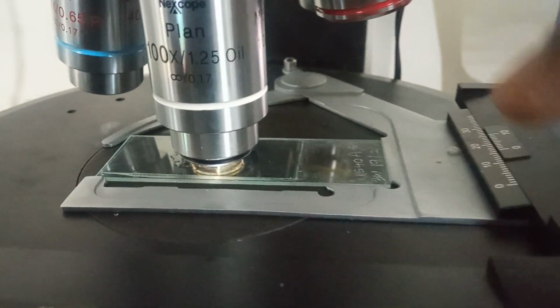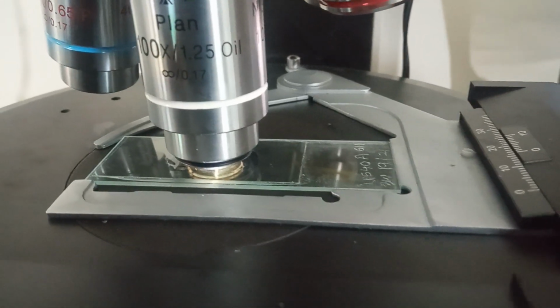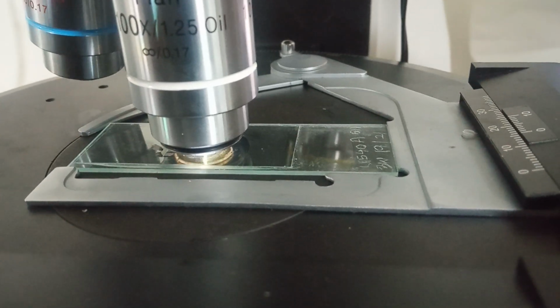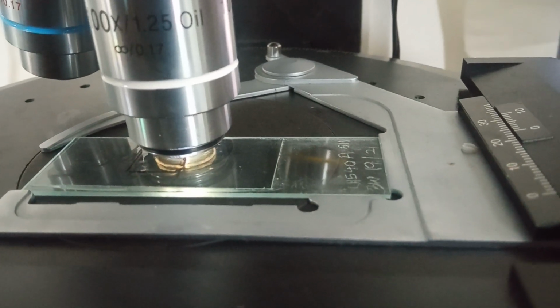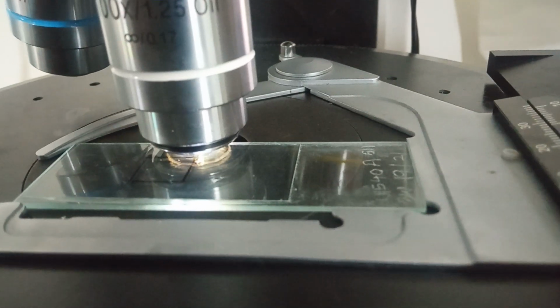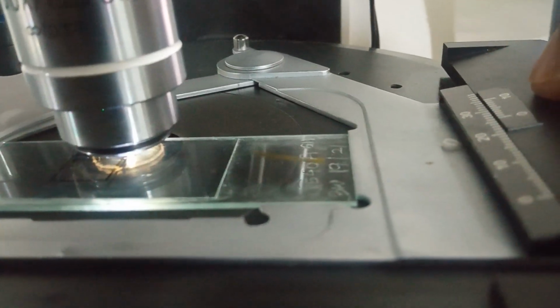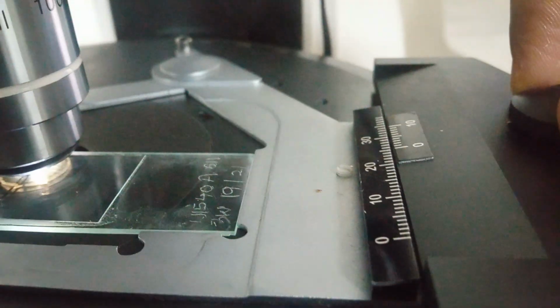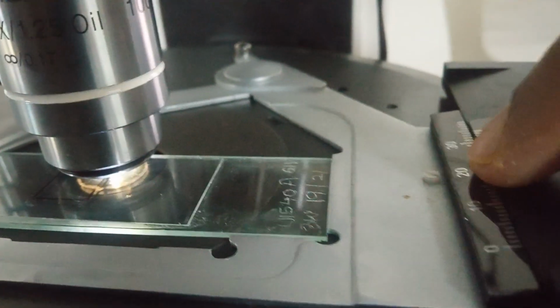Let me show you. Currently the slide is in the down vertex, so we want to move up. So we are going up. When we reach the edge of the upper vertex, we can see we are around, yeah, we have added more units, the same units, to complete.